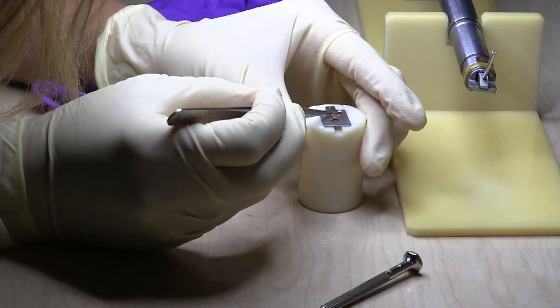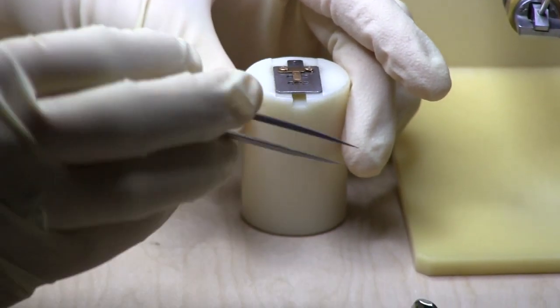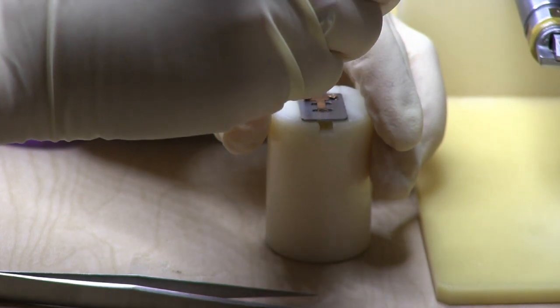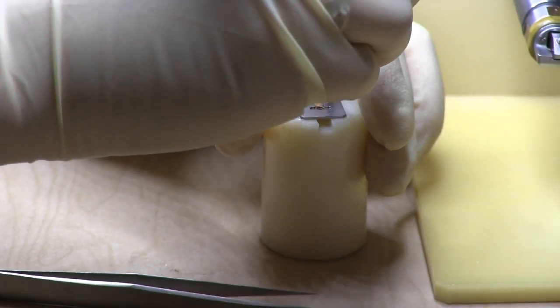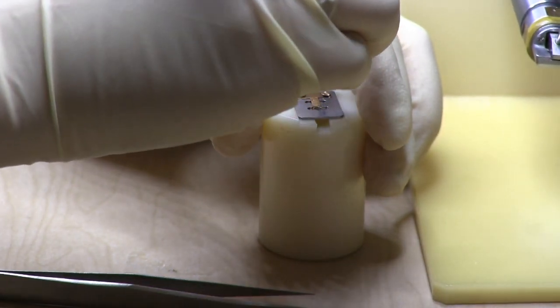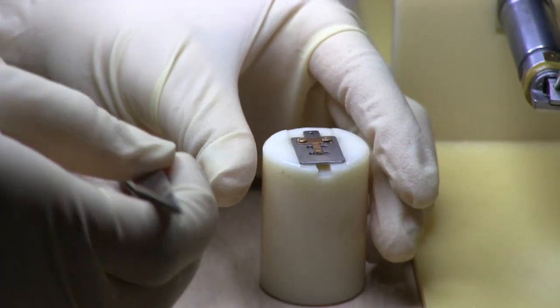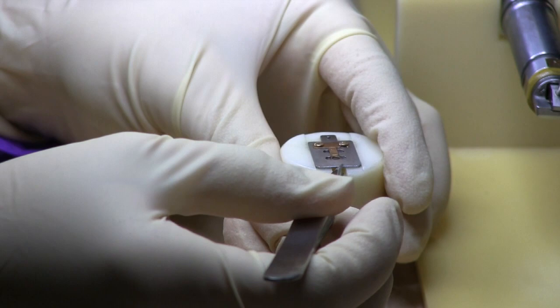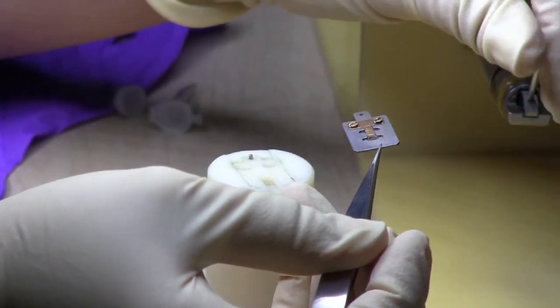My research this summer has focused on decreasing the length of these ligands to study the effect that that has on the properties of the quantum dot films. I can either do this by synthesizing quantum dots with shorter ligands or by exchanging them for shorter ligands after synthesis. I have tried both methods this summer with varying success.